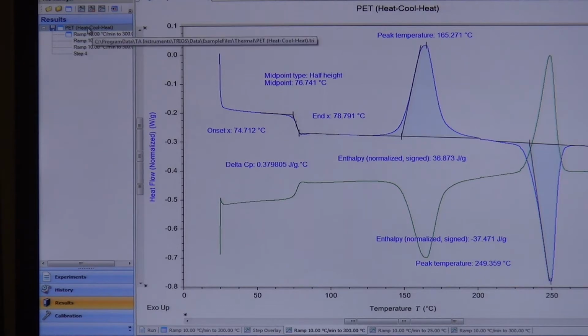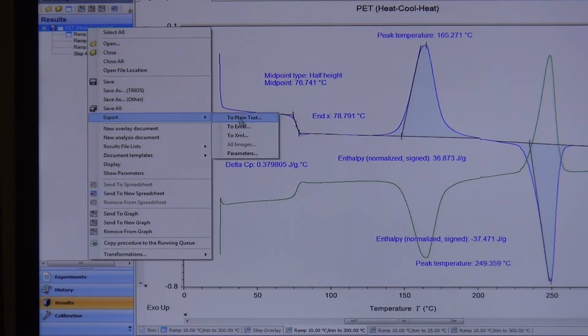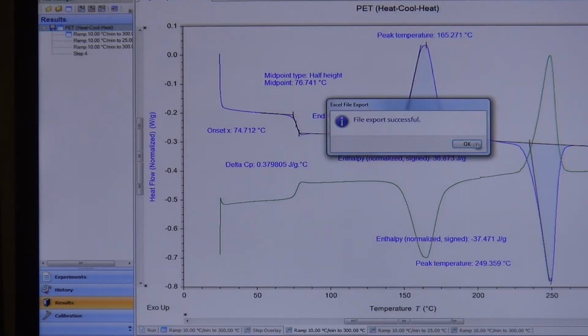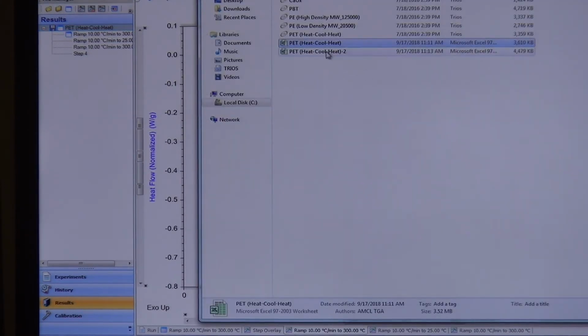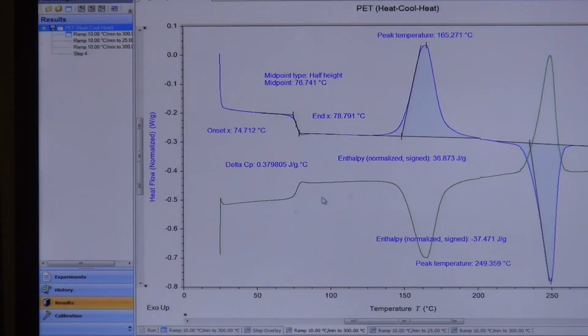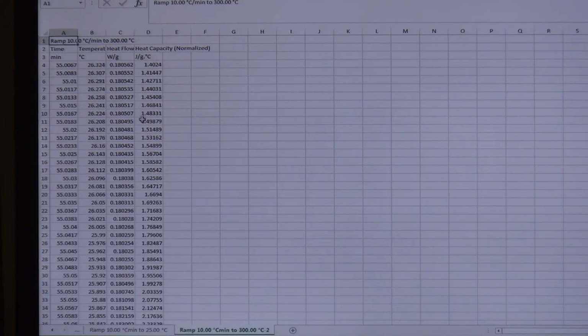All I have to do now is resave the data. File export successful. And when I go in, I have another data file. And you can see now I have my heat capacity column plotted right up there. So I don't need to necessarily manually do any calculations in here. As long as I can plot it on that graph, I can save it as its own data set and have a separate column with it right there. So I don't need to do any extra stuff going into any other software or anything like that. Everything can be done directly through Trios and then basically just copied out. Okay, which I think is actually pretty nice.